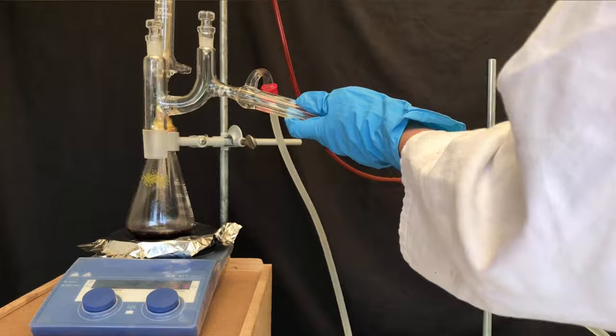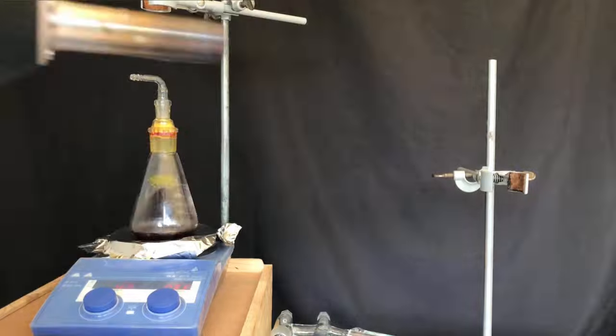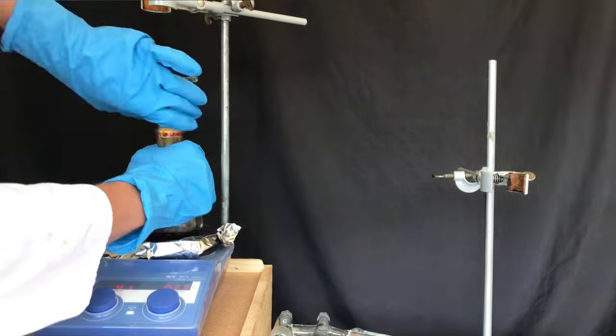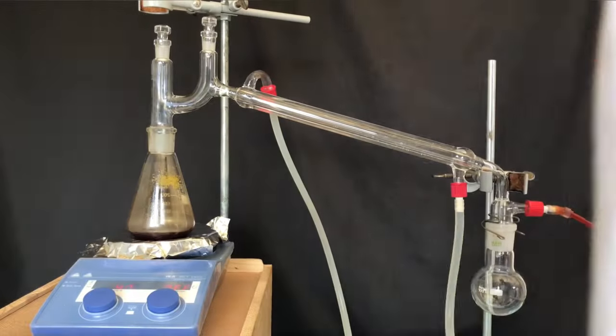As I disassembled the apparatus and tried to connect the distillation bridge, I stumbled across a problem. I wasn't able to disconnect the glass adapter thing, so I used the heat gun to gently heat it up, and afterwards it was easy to remove.